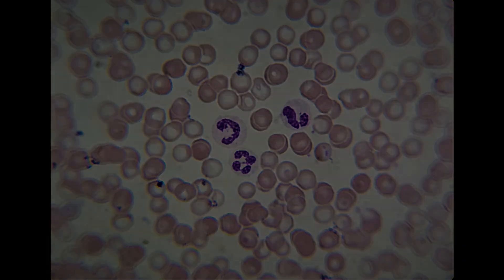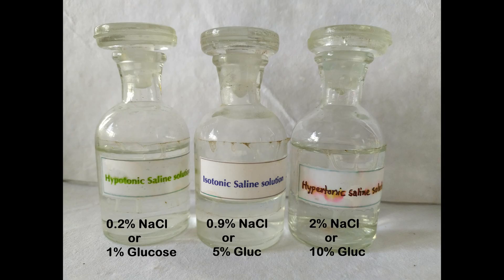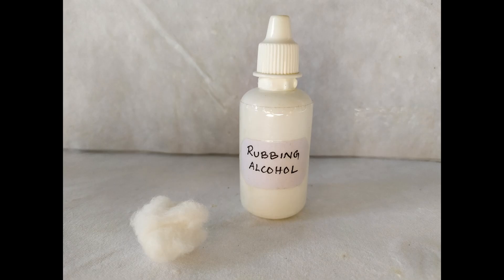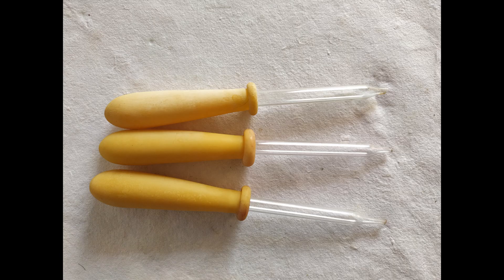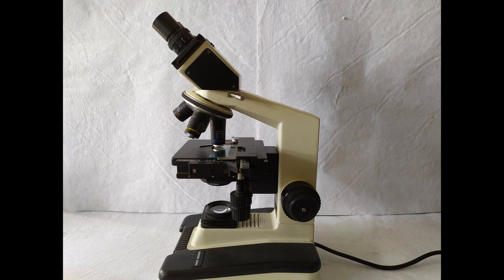For this experiment, we'll need the following: hypo-, iso-, and hypertonic solutions of either sodium chloride or glucose, glass slides and cover slips, cotton and rubbing alcohol, a pricking device or blood lancet, three droppers, three mixing sticks or toothpicks, and a compound light microscope.